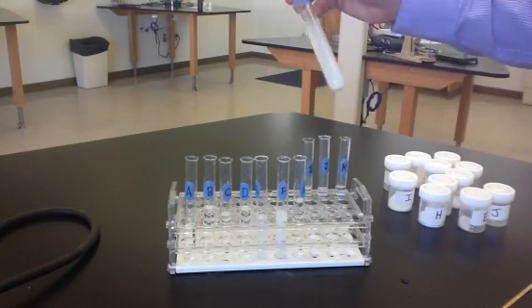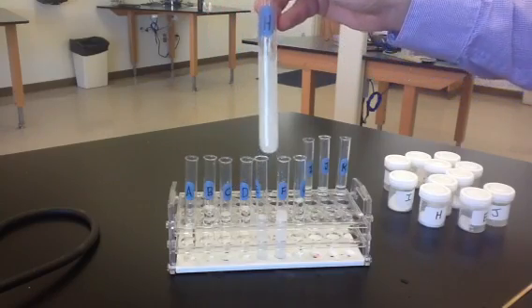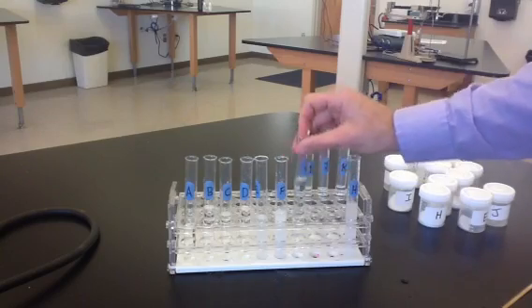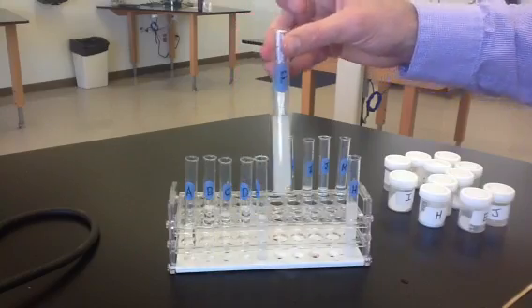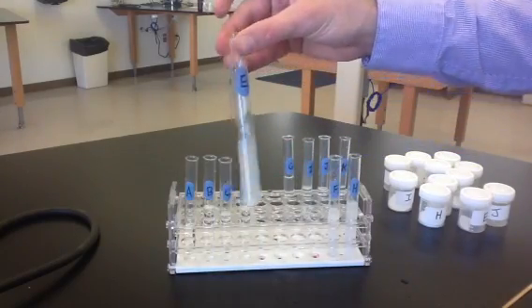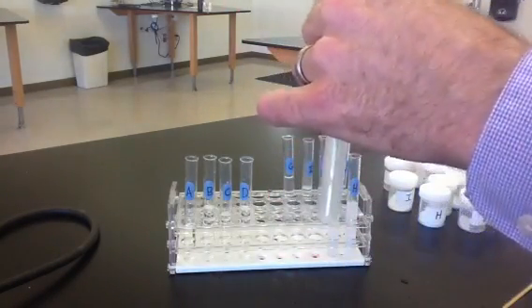We'll look at H, and H appears not to be dissolving in water. You can see how the substance is cloudy, making the water cloudy, and it's not dissolving. So I'll put that one over here. We have G, which appears to be dissolving. It's making a clear solution. F appears to be cloudy, therefore not dissolving. E, let me stir this one a little bit. E looks like it is not dissolving.